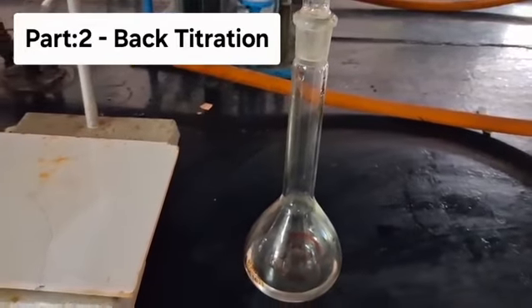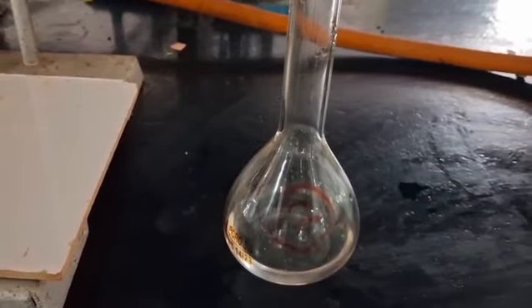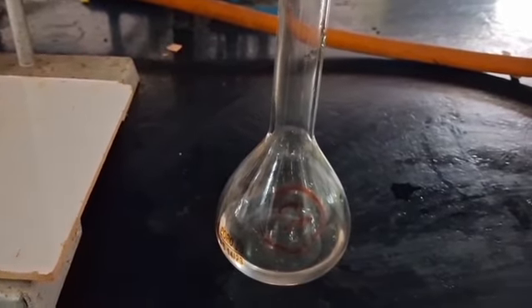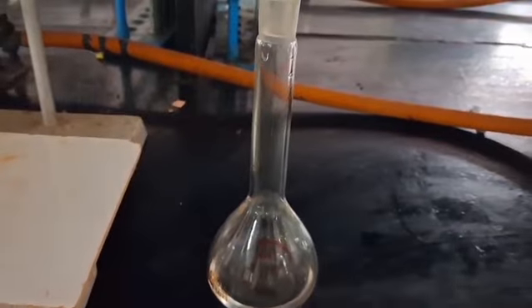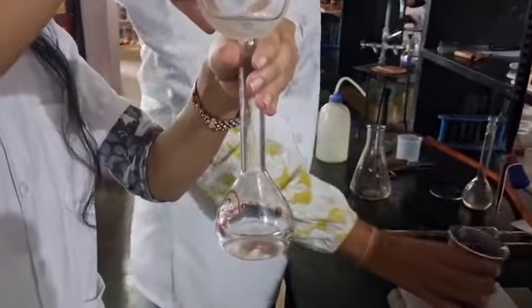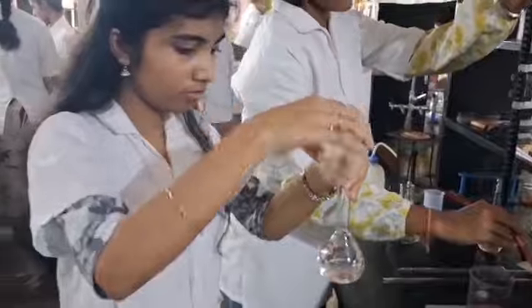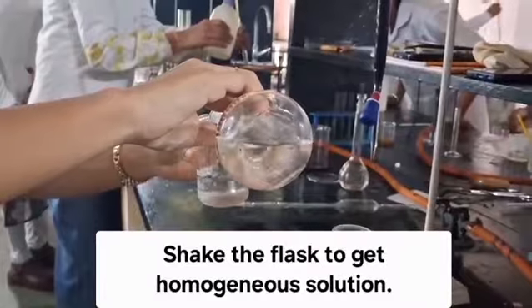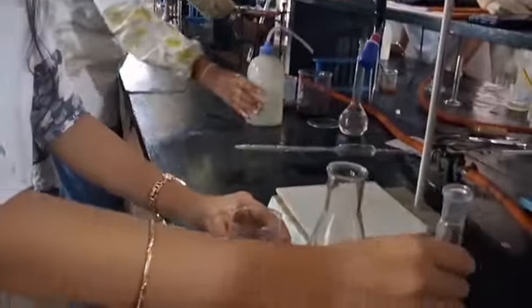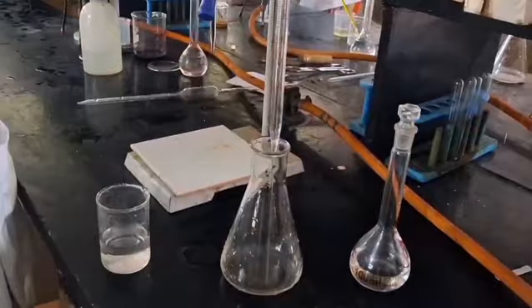Now let's do the estimation part, that is estimation of persulphate ion solution. You are provided with an unknown sample solution of persulphate ion in a 100 ml standard measuring flask. Dilute the flask up to the mark by using distilled water. After complete dilution, shake the flask. Transfer the diluted solution into a beaker and pipette out 10 ml of it into a 250 ml conical flask.